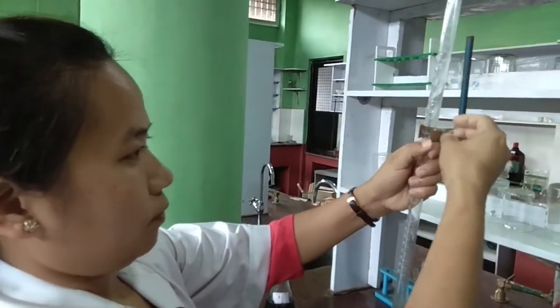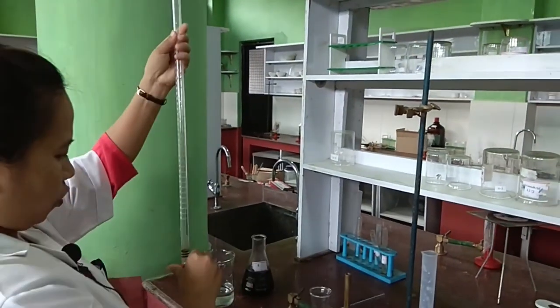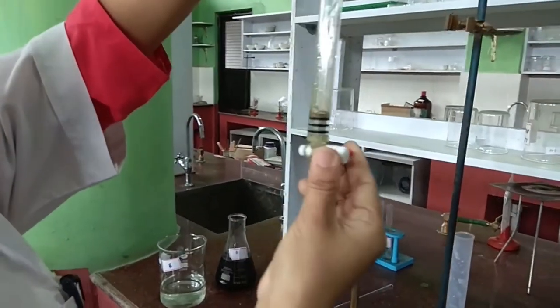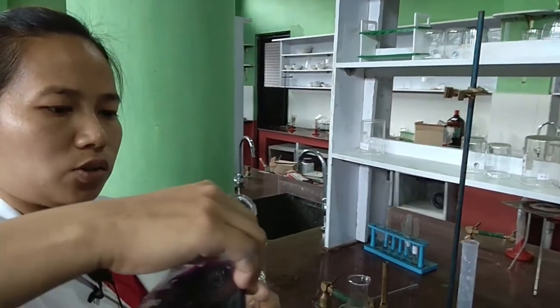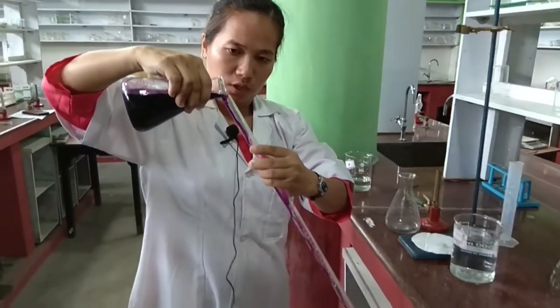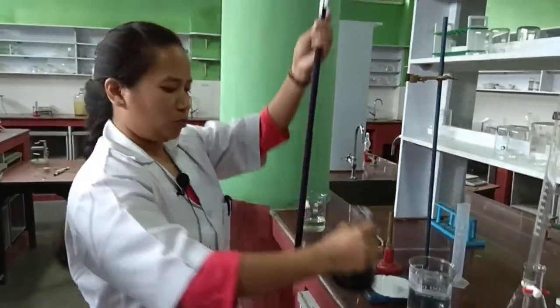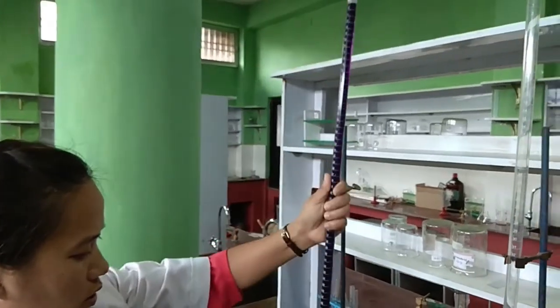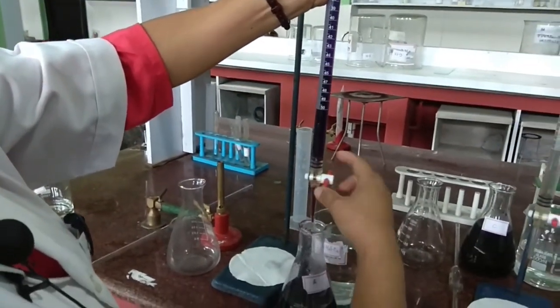Now, this is the burette. We take this burette and transfer the KMnO4 solution into it. First check whether it is closed or not. You can transfer the KMnO4 solution with the help of a funnel also. Fill it a little more, because you have to open it and fill the space below the tip of the burette.